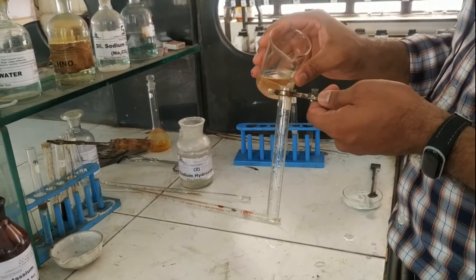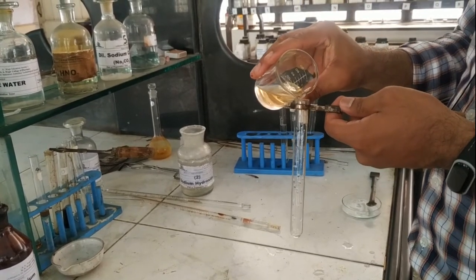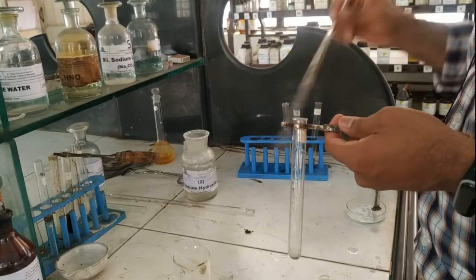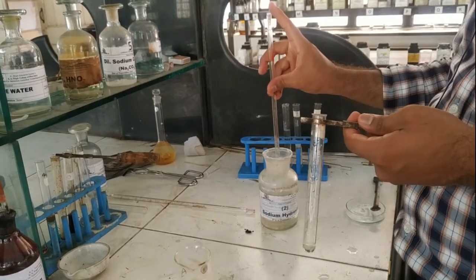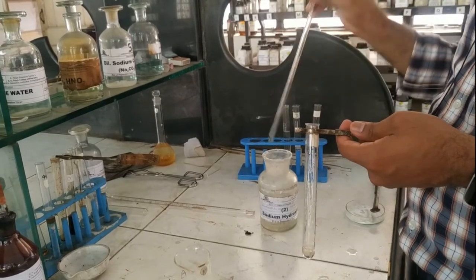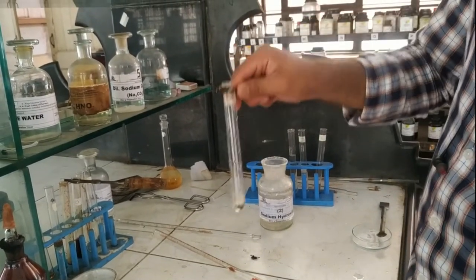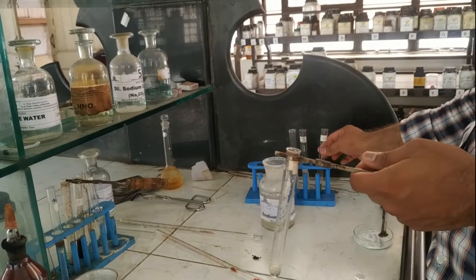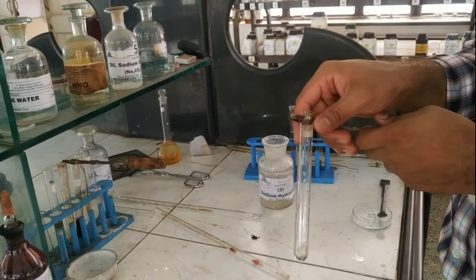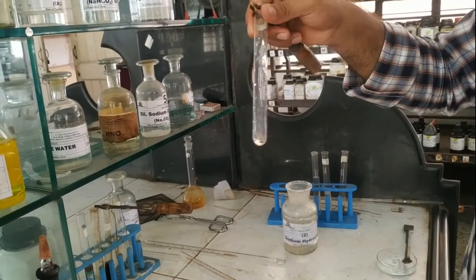First test is detection of nitrogen. Take a test tube and add 1 ml of sodium fusion extract, then add 2 to 3 drops of NaOH solution and shake the mixture. After that, add 2 to 3 drops of FeSO4 solution. Here there is no change in color, so nitrogen is absent in the compound.